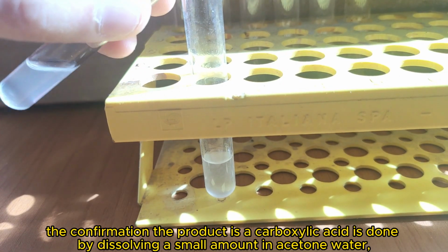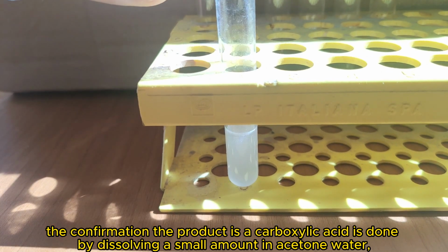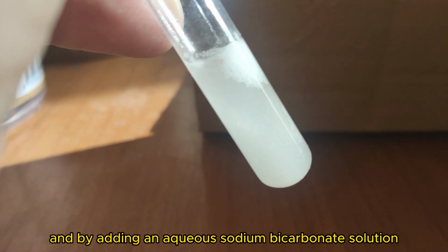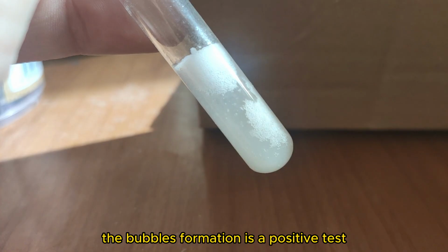The confirmation that the product is a carboxylic acid is done by dissolving a small amount in acetone water and adding an aqueous sodium bicarbonate solution. The bubble formation is a positive test.